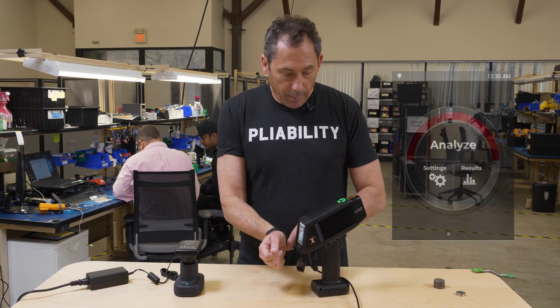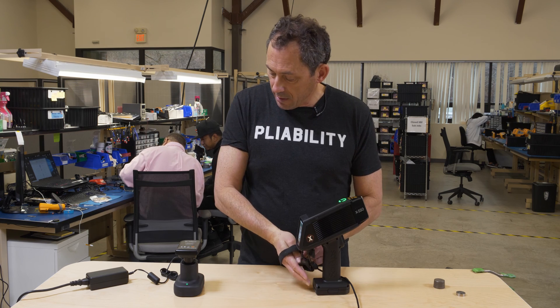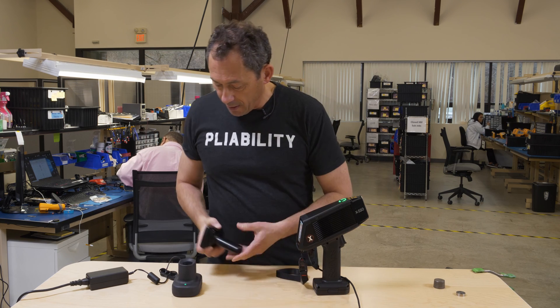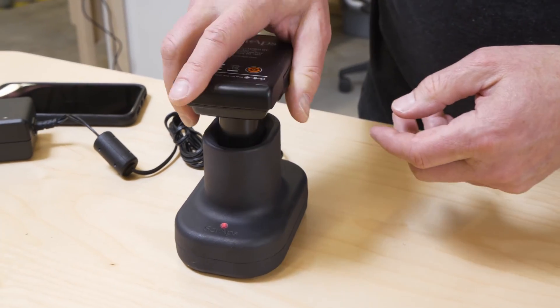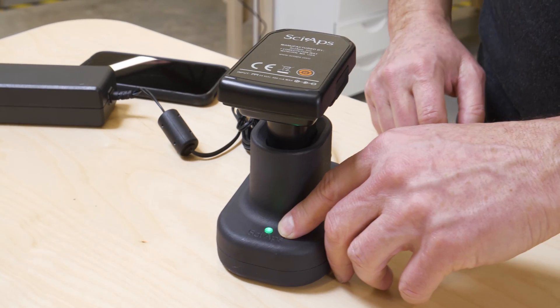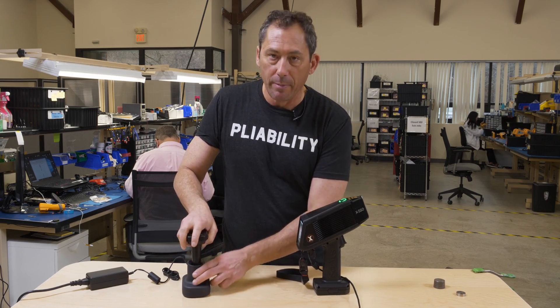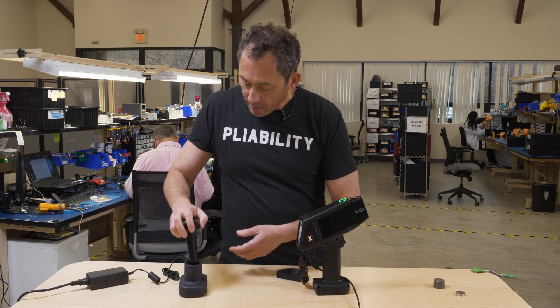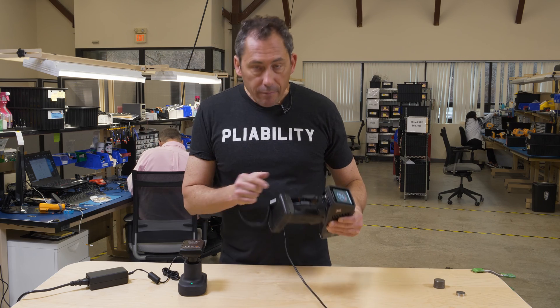In terms of the battery charger, here's the charger base. When it's plugged in you have a red light; the battery goes in like that and it switches to blinking green when it's charging, and solid green when it's fully charged. Again, the battery is keyed so you can't jam it in the wrong way.